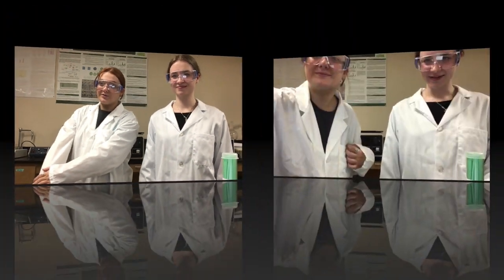So Nat, what materials are we using today? Well, we're going to be using plenty of different materials, just like any good artist would. But first and foremost, we need to address the most important part about working with bacteria: lab safety. You always want to be wearing some thick protective glasses to protect your eyeballs and a lab coat to protect your skin and clothes. You don't want any of this nasty stuff getting on you because you will get sick and you will die.